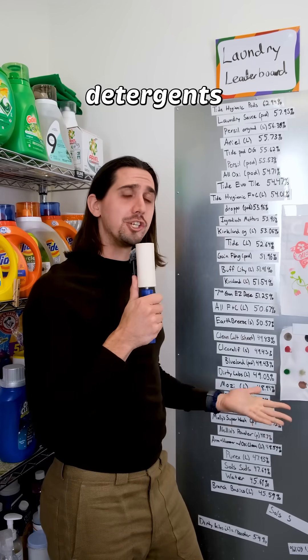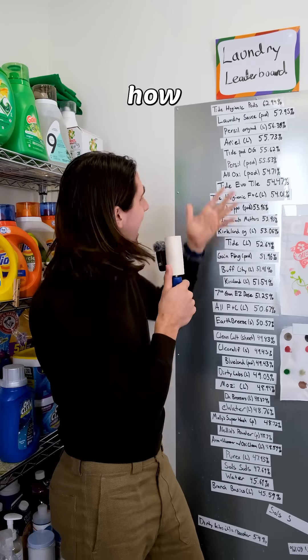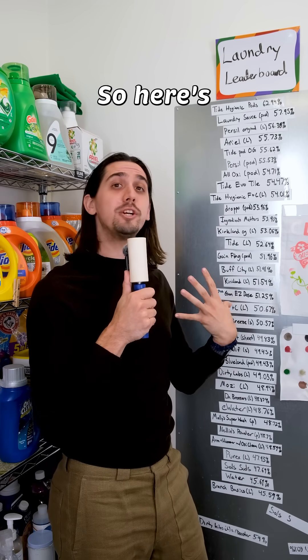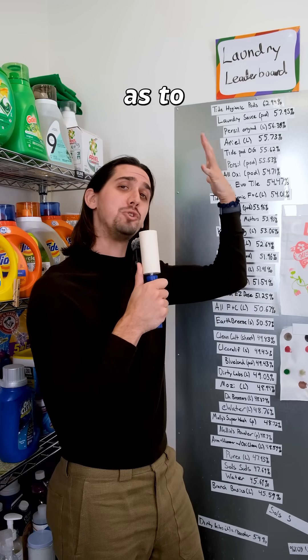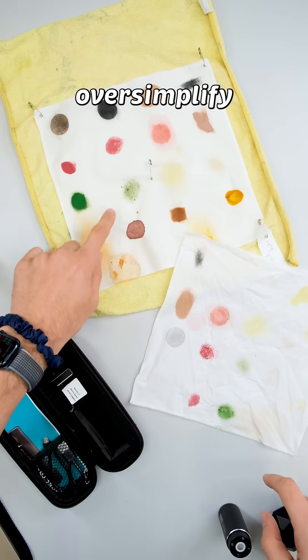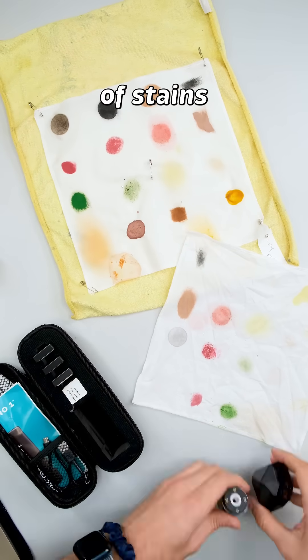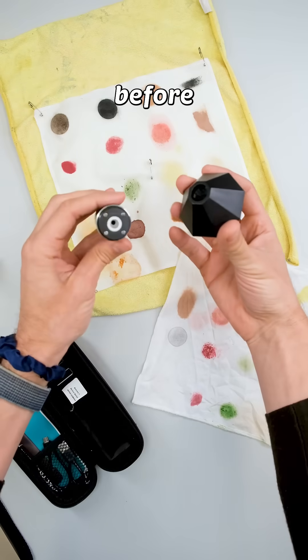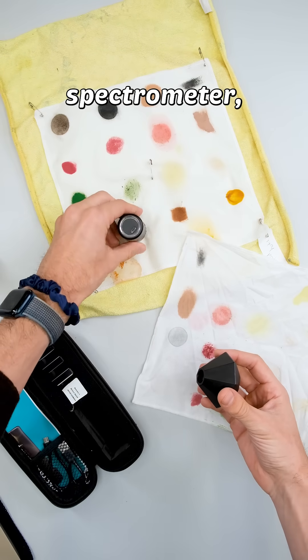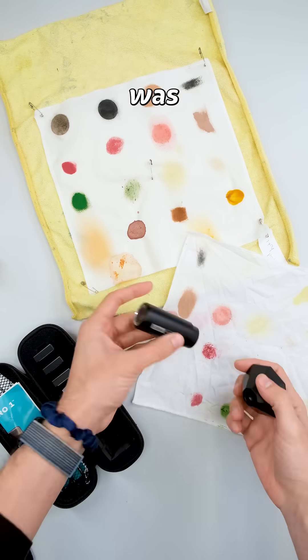Hey, I review laundry detergents and a lot of you have been asking, Zach, how do you get these numbers? So here's an explanation of my process. To oversimplify it, I use a variety of stains and measure the color before and after with a spectrometer, which tells me how much of the stain was removed.